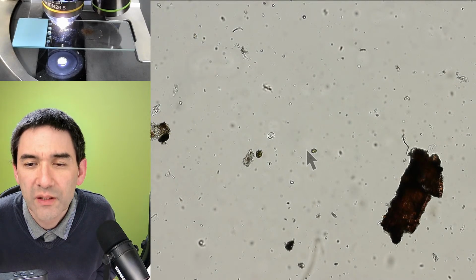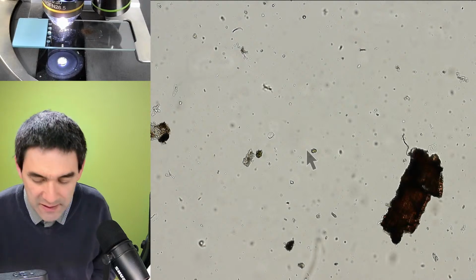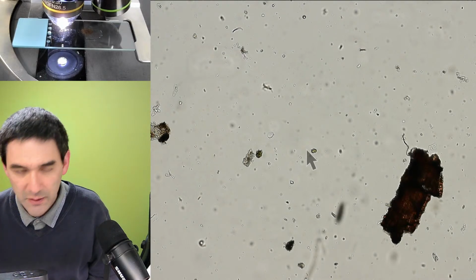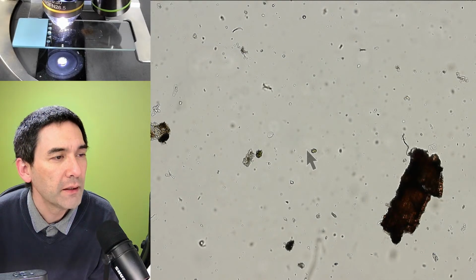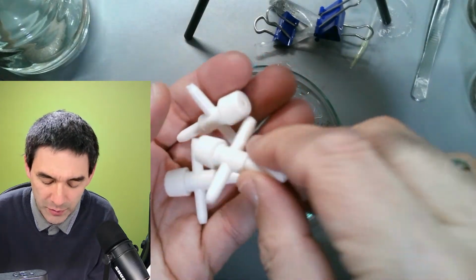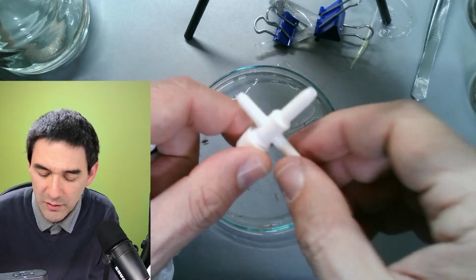Okay, but there seem to be no more questions. In aquarium shops, you might find valves. Yes, as a matter of fact, look what I've got here. And I'll also show this to you. And where is the desk view? Now, these are some of those things that you can connect. You can connect those tubes.